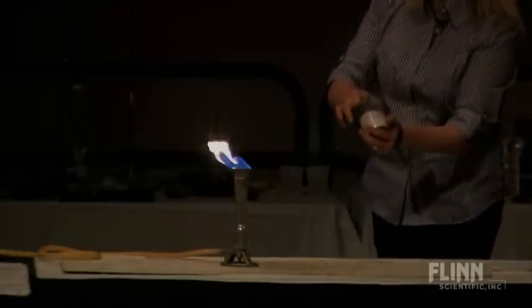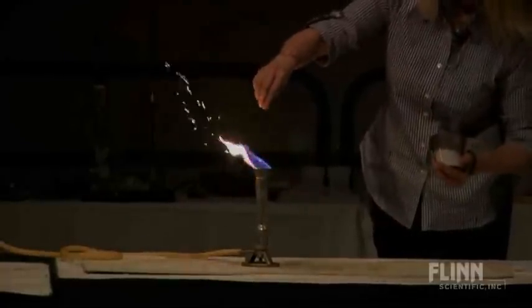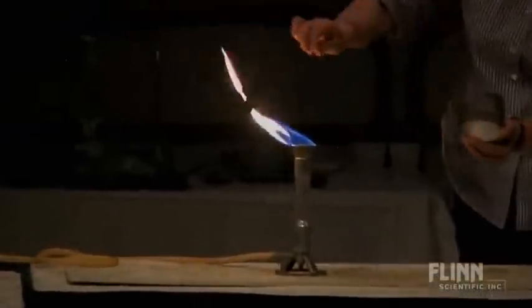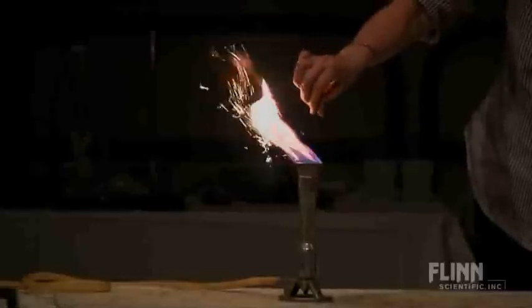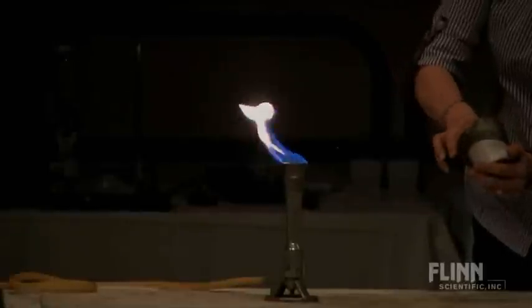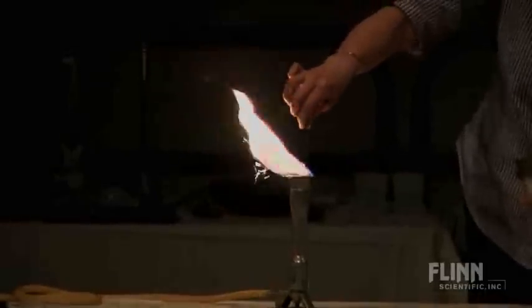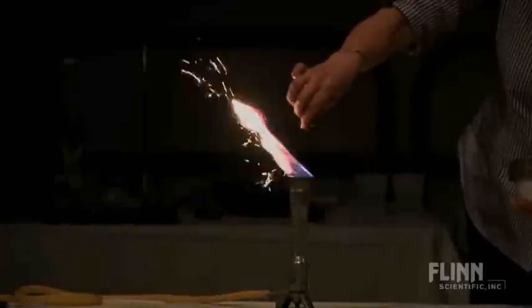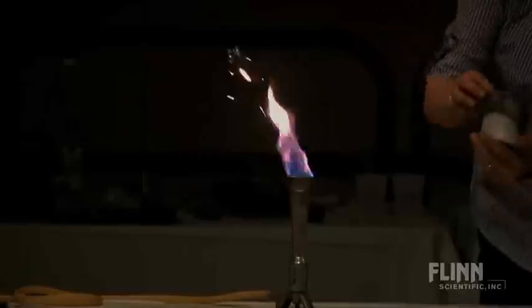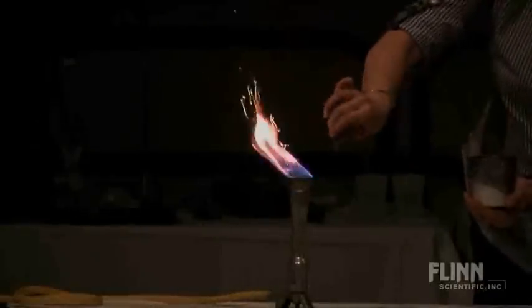We're going to sprinkle just a little bit of iron into this flame. Pretty! So little powdered bits of metal — that's so lovely. I learned at Pyro School that if you have different mixtures of iron with a little carbon in it, it's really nice and sparkly and you get this nice sparkle look. I also learned that the kind of metal used in sparklers — if you have golden sparklers, you use iron, which sparks nicely. It's got a little bit of extra carbon in it.